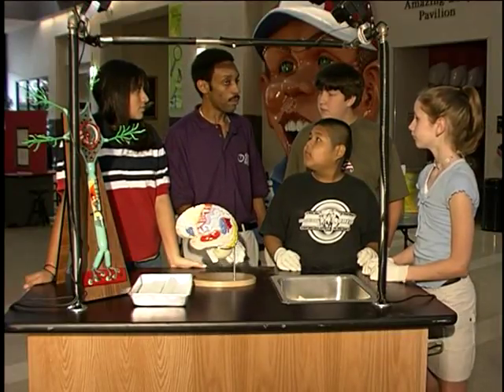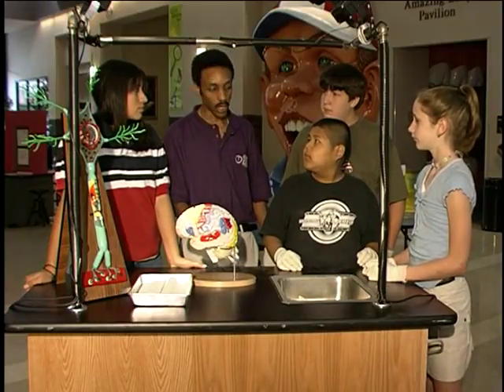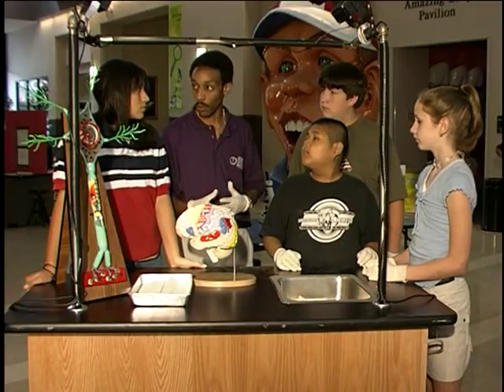Today we're going to be performing a sheep brain dissection demonstration. Basically, we're going to take a real sheep's brain and begin to take it apart and have a better look at what's going on inside of the brain.